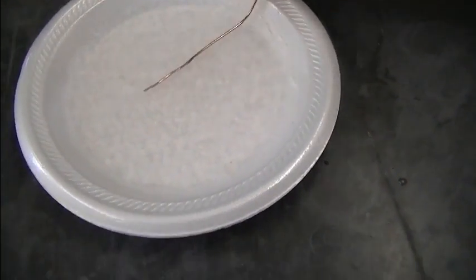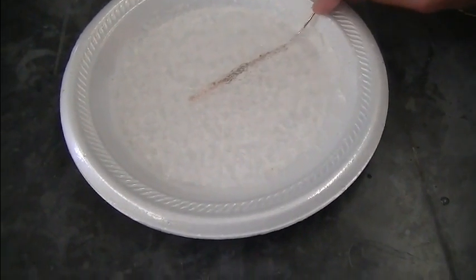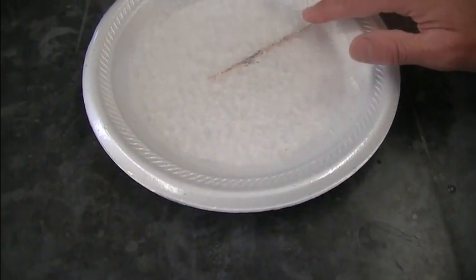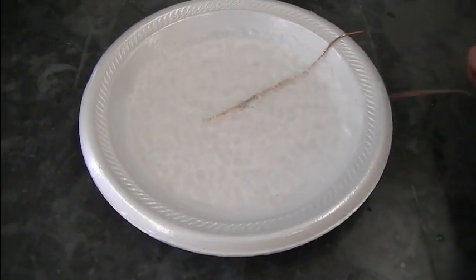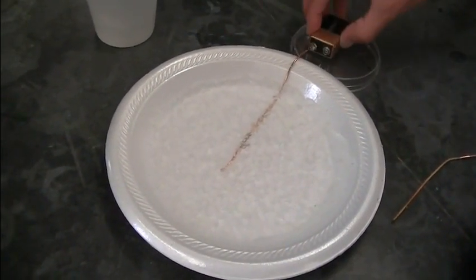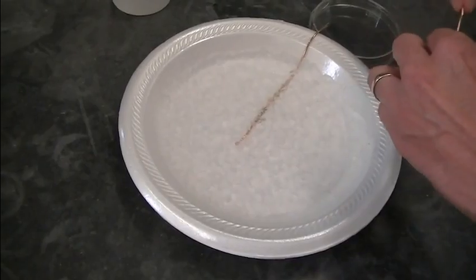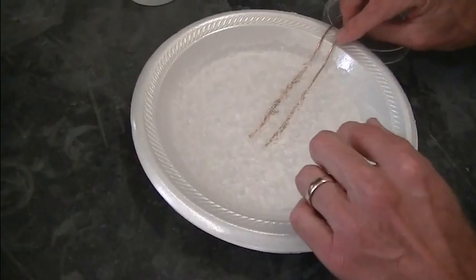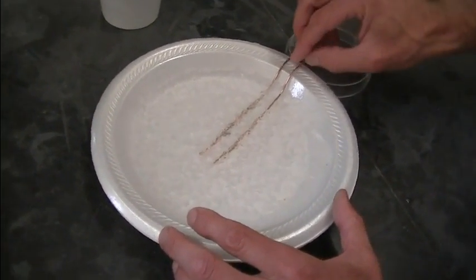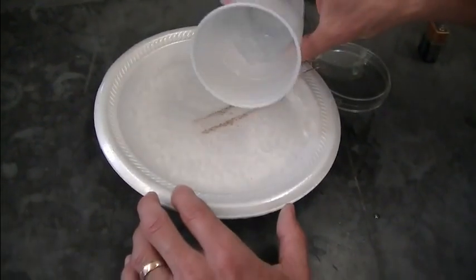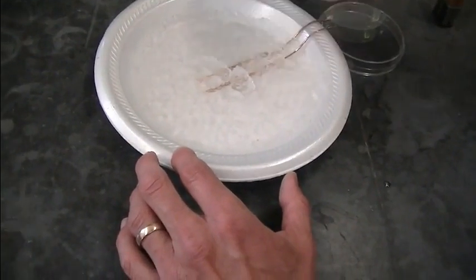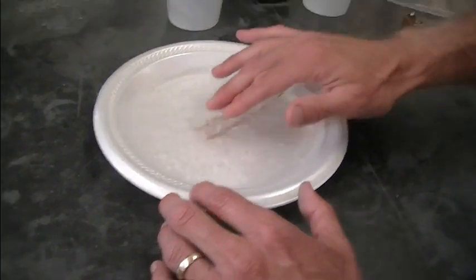Now I'm going to take my two copper electrodes and I've bent them so that they'll go into the gel mixture. But this part will be up over the top of the lip of the plate so that I can set the battery here like that. I'm going to put this one in about a centimeter away from the other one. Like that. I want to make sure those are covered. So let's just put a little bit more gel in there. Just enough to make sure they're covered.